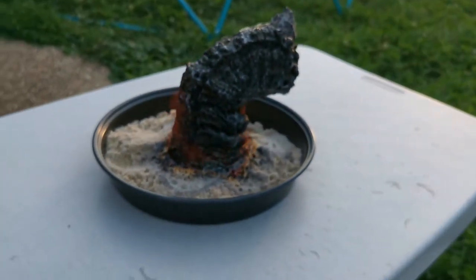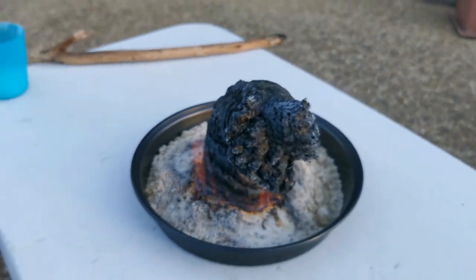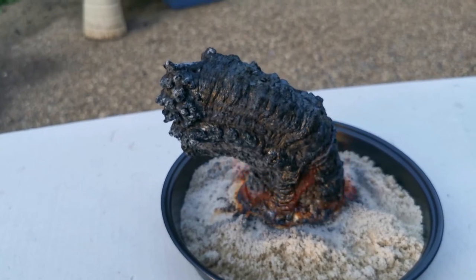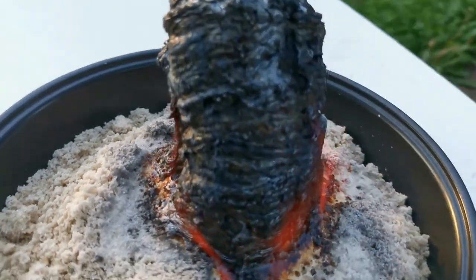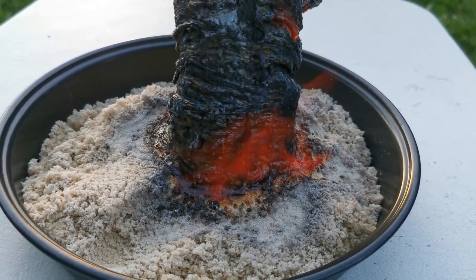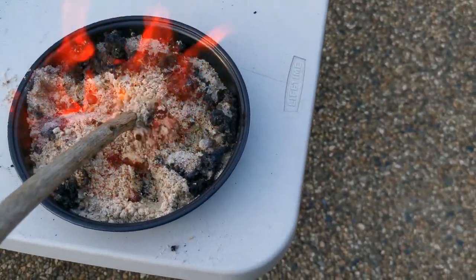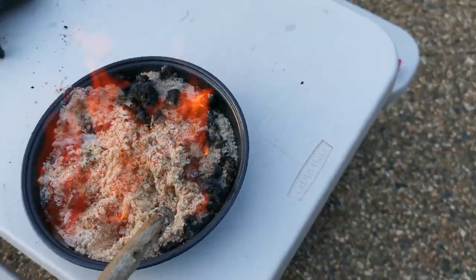Just grab the phone and go for a bit of a 3D tour. So yeah, definitely sort of slanted off to the right now, fell over a bit. A little bit of action playing down at the base, really not much though. All I'm doing now is just exposing any leftover ethanol and just burning that away. I don't want any ethanol left in my sand when I get rid of this.